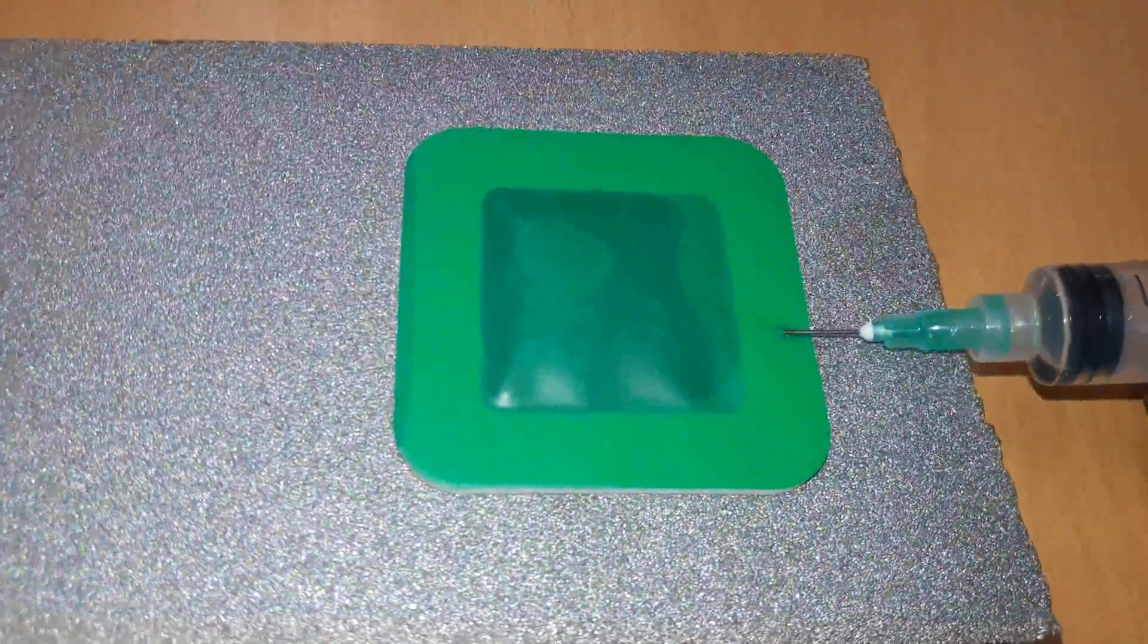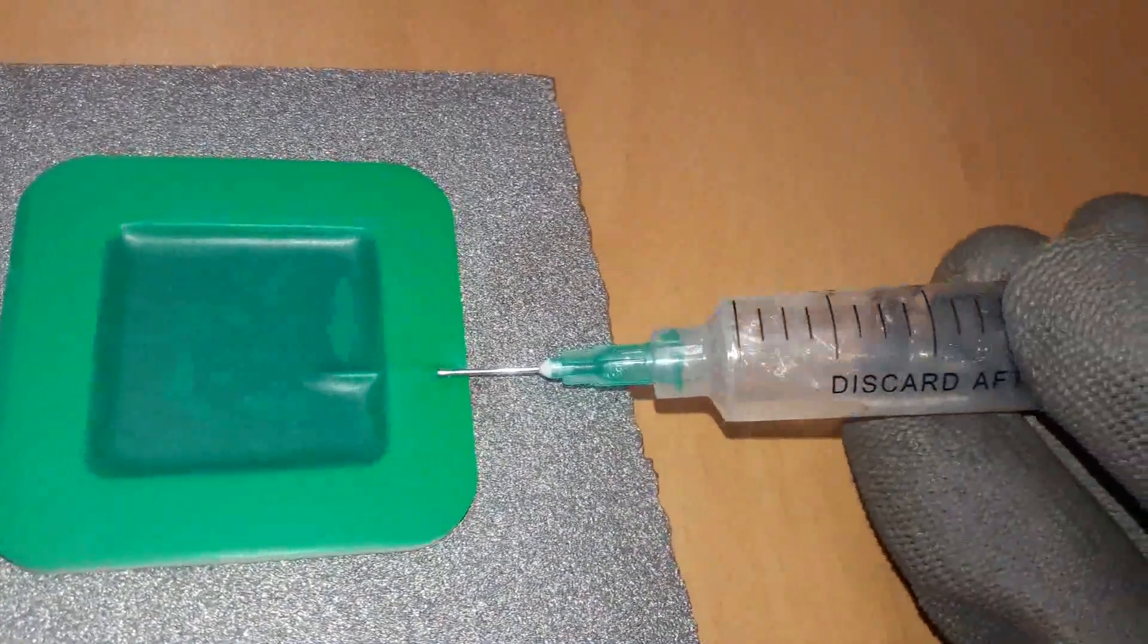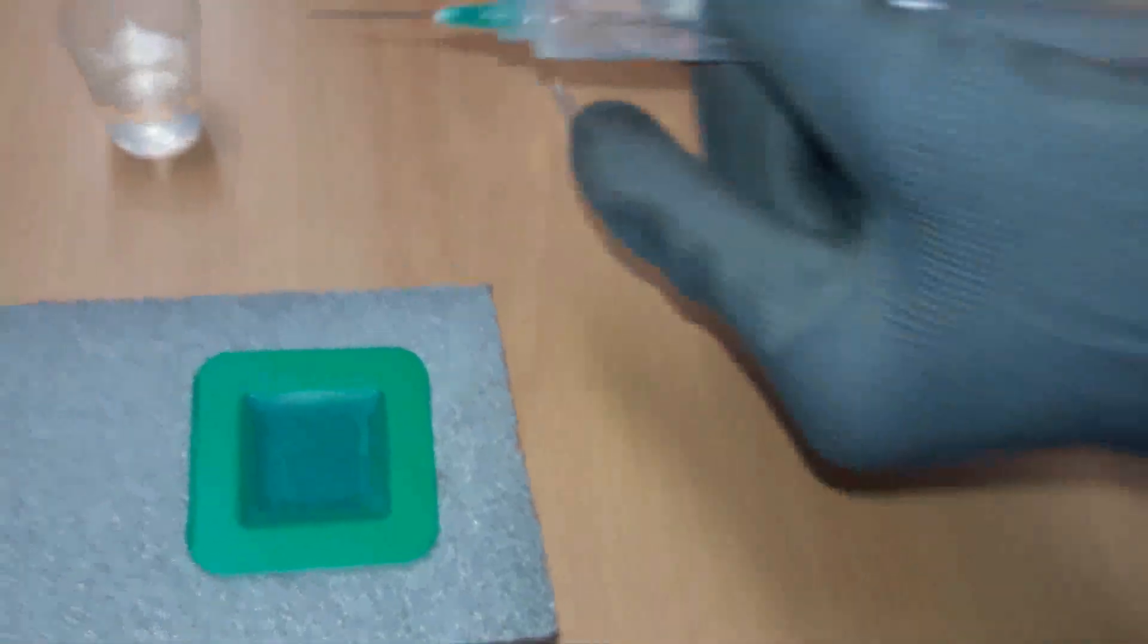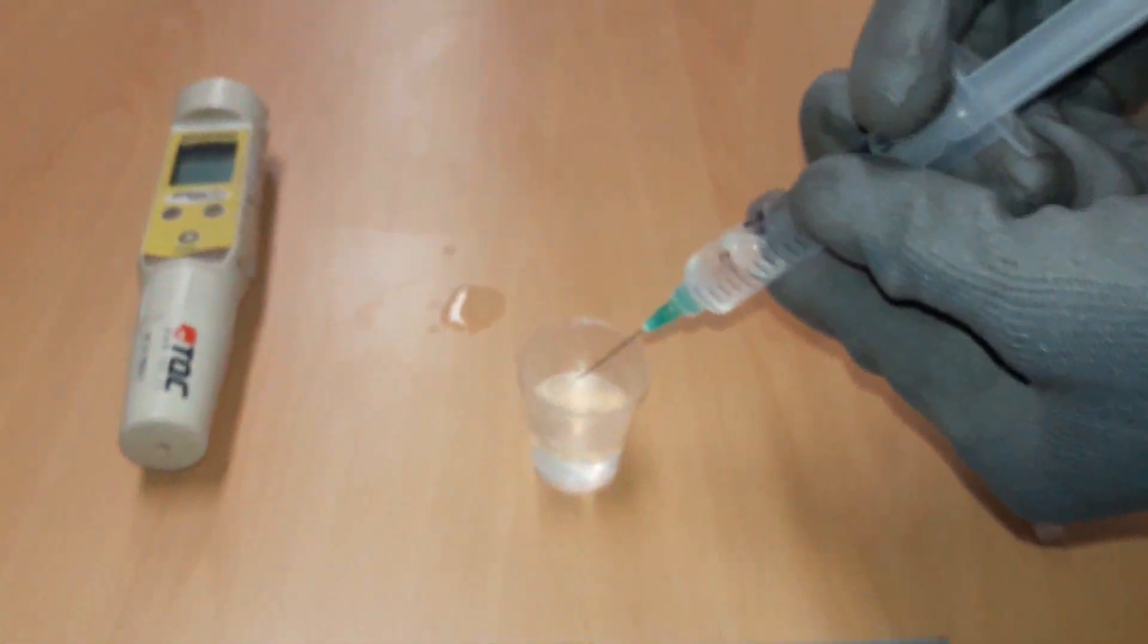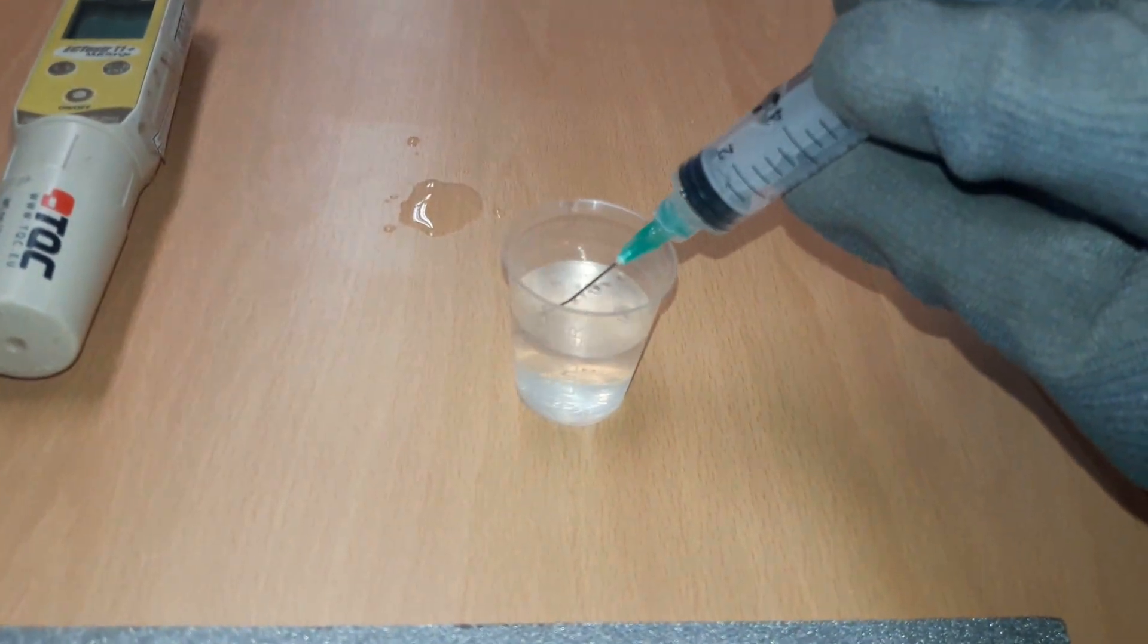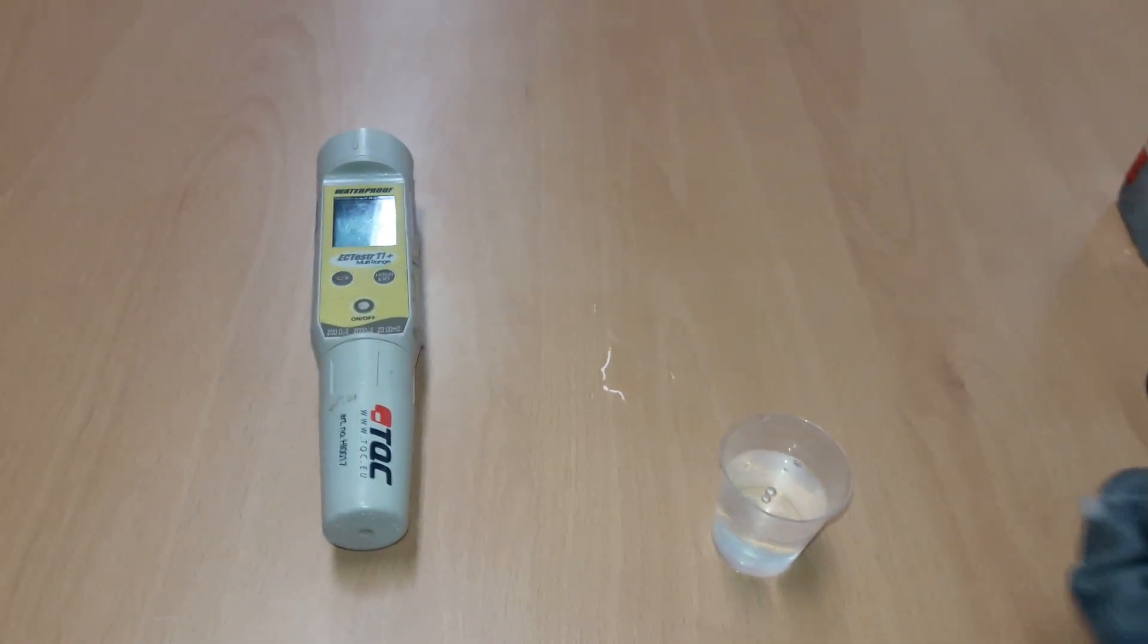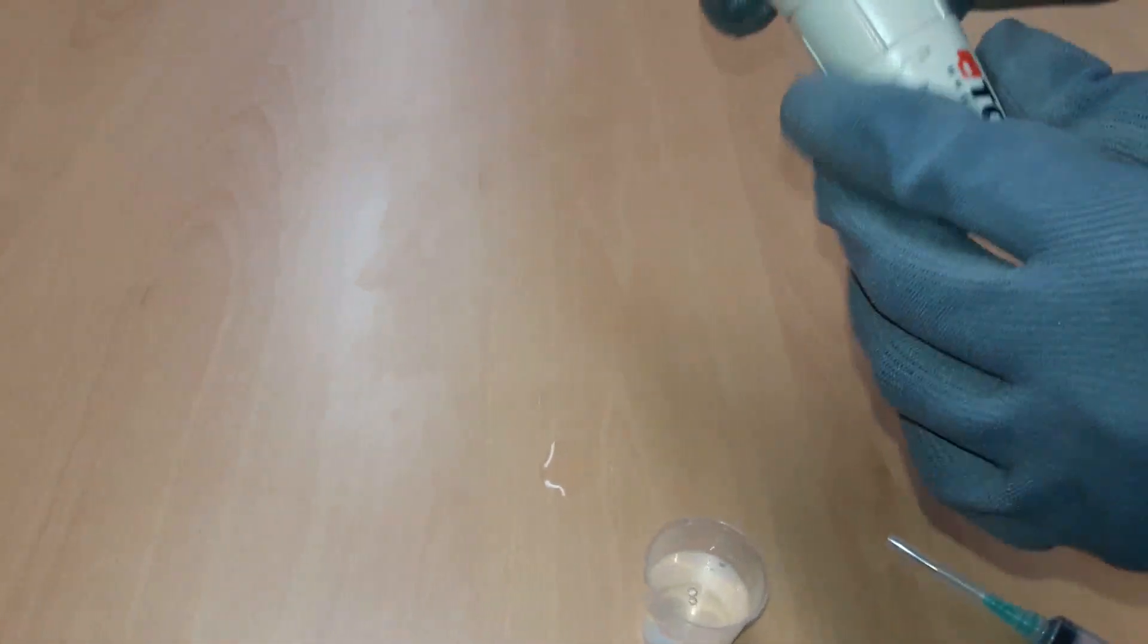At the end of the last cycle, retrieve as much as possible of the solvent from the compartment and transfer to the 25 ml beaker. Immerse the electrode of the conductometer fully in the now contaminated water in the beaker and record the conductivity.